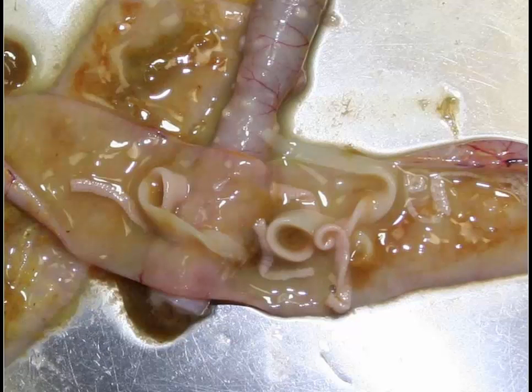Slide number 5 is a parasite. Gotta love the parasites. This is tissue from a chicken. Please name the agent. Well, this is a cestode of chickens, very commonly seen. Usually doesn't cause much of a problem. You'll cut in a section and you'll see a cross section of this adult cestode.